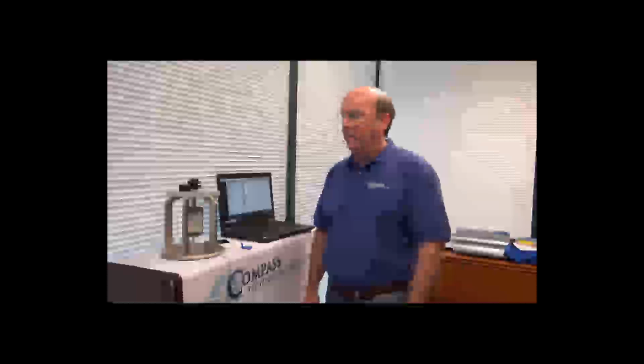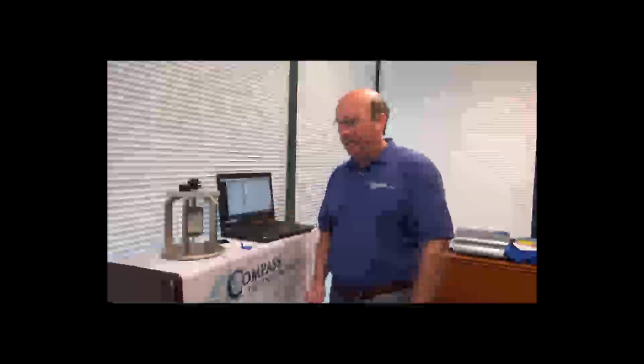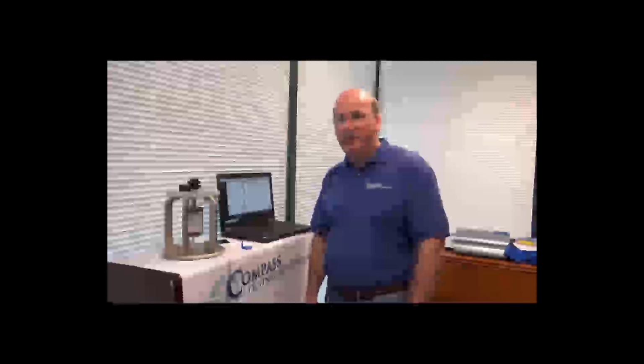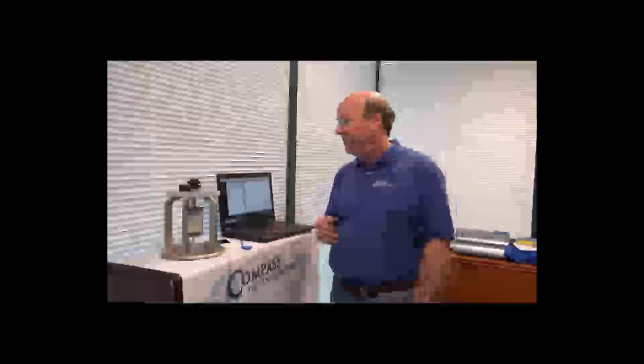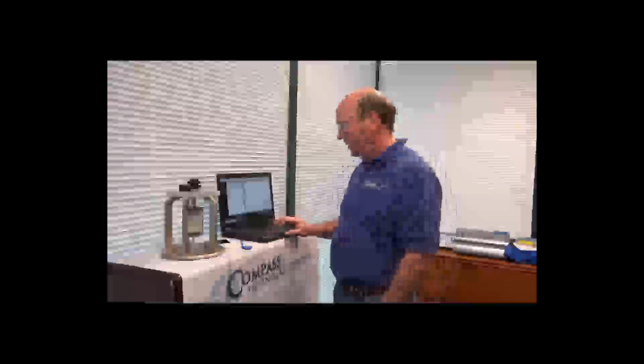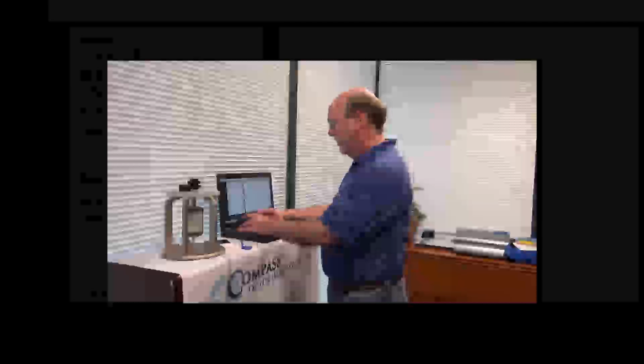And today I'm going to walk you through the operation of the dielectric epsilometer device measuring an unknown sample. We have the software open, and we've already connected to our device. So the first thing we're going to do is fill out the description, which in this case, we're just going to type demo.